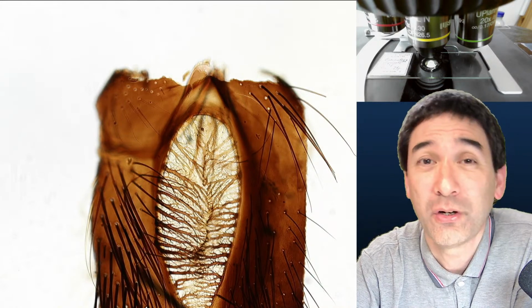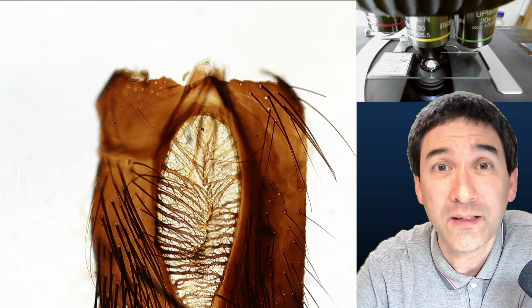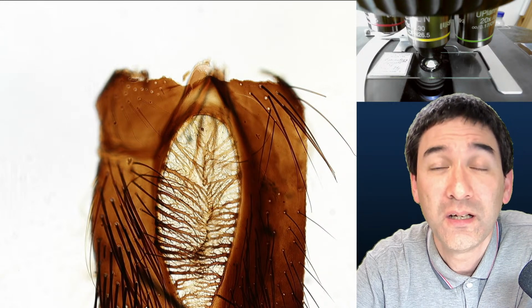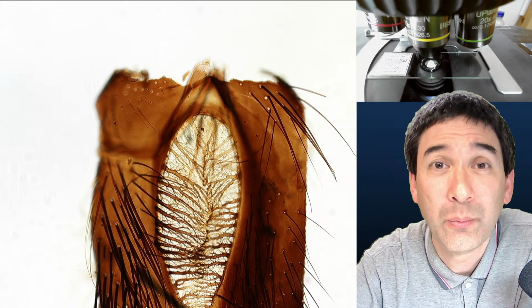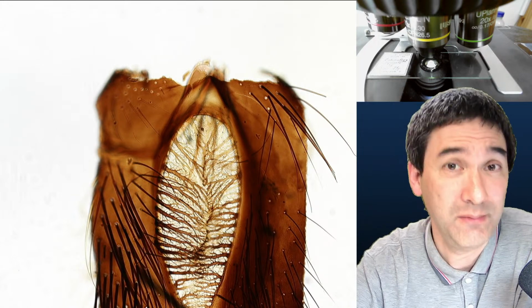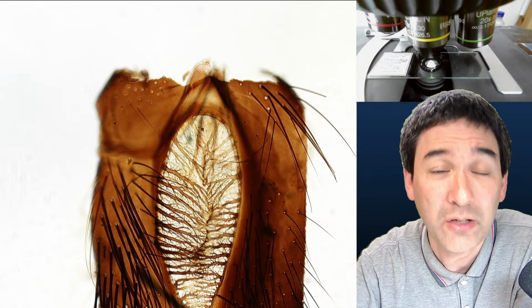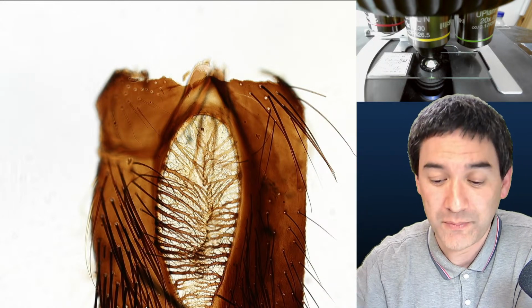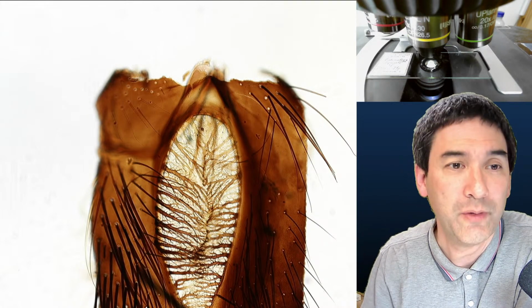I know there is, for example, a German company called Lieder.de, which has a pretty extensive online catalog where you can also buy individual slides. But you've got to be aware, some of them are quite expensive because these are really quality slides. And they're pretty much the same quality as what we have got here, right?